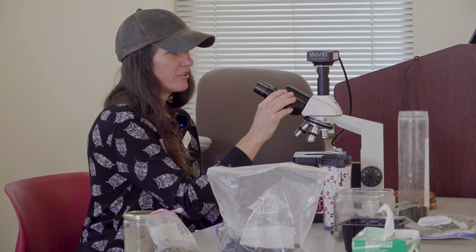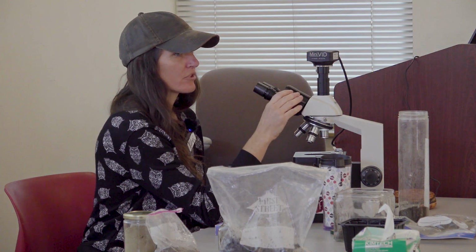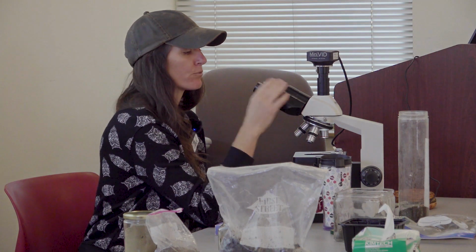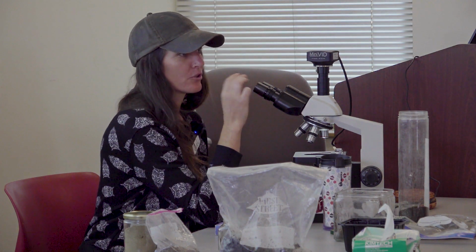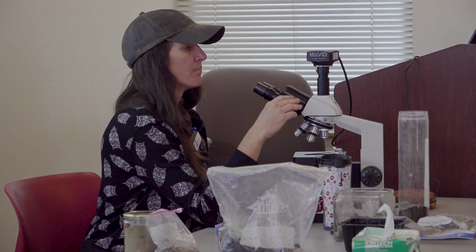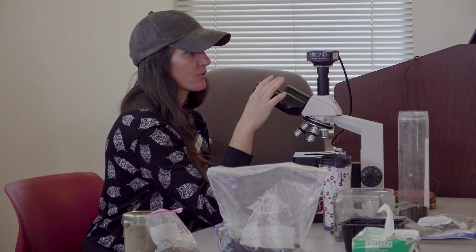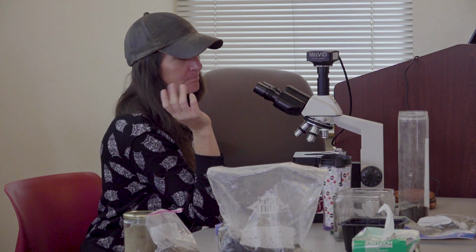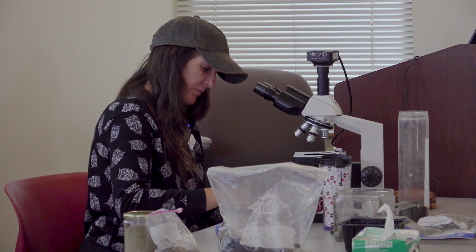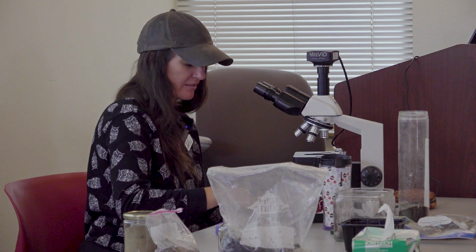This one is a trinocular, so it has the two eyepieces plus the tube here. I need at least a binocular microscope because when I'm performing assessments for work, usually I'm doing multiple in one day, which takes several hours. And it can be really strenuous looking through a single eyepiece for long periods of time. But if you're just looking at your own compost samples, that can really bring down the cost of your equipment. Mine is a trinocular because I also want the camera port, but to be able to comfortably sit and watch this. So I can go through a lot of samples and you can all watch me do it at the same time. So this microscope was not cheap, but that doesn't have to be the case. I think my first microscope ever, it still had a camera, but I paid $500 for the whole setup, and half of that was the camera.